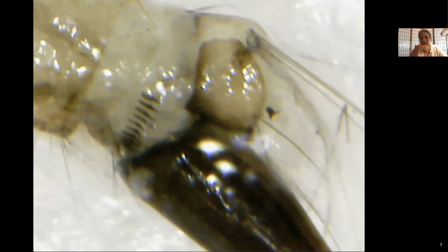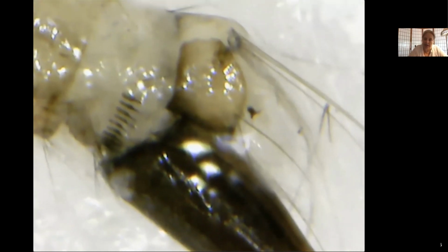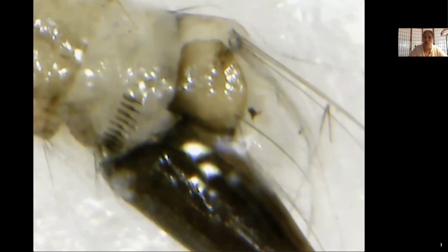It is just there. And what we do is we see a series of hairs underneath the saddle, but it is either above or below. In this case, it's below, but not piercing the saddle, and the saddle does not go around. So already we have a pretty good idea of what this specimen is.